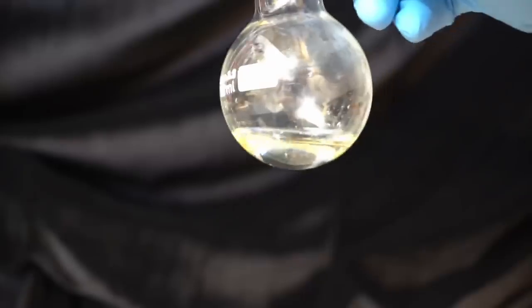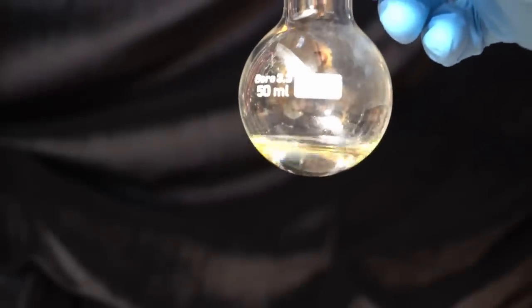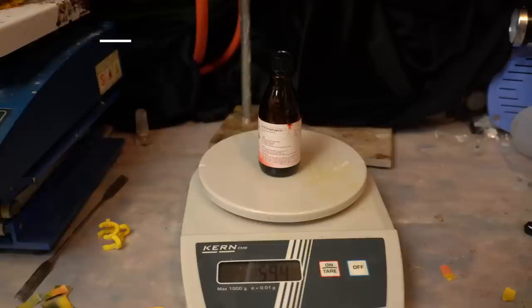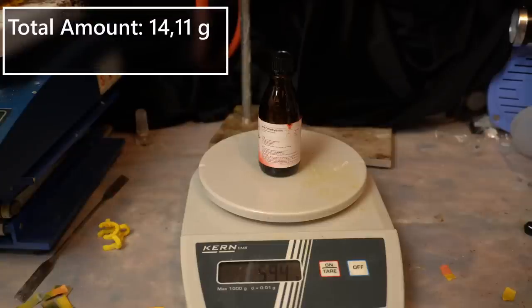After two more hours of unnecessary work, I've gotten almost the same amount as before. The total amount that I have now is 14.11 grams of dimethylaniline, which gives us a yield of 38.8%.